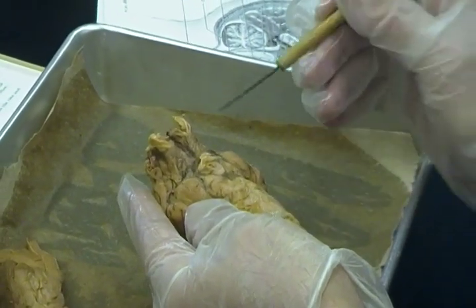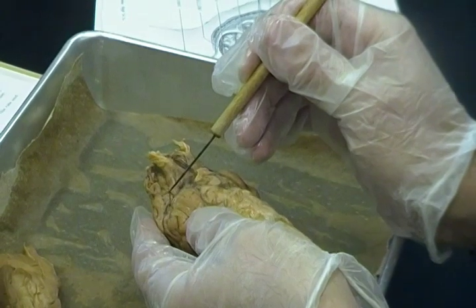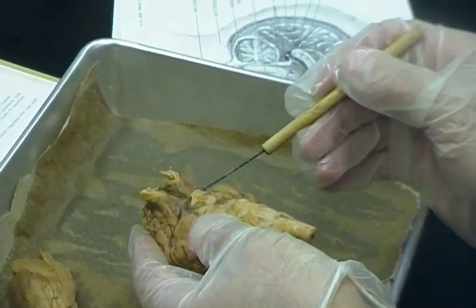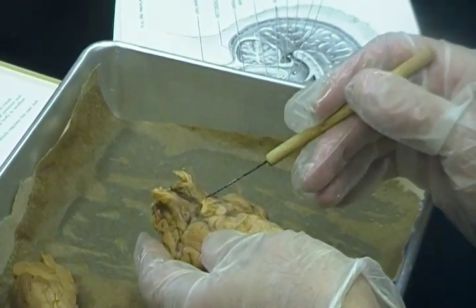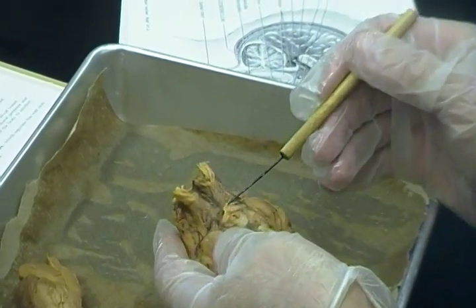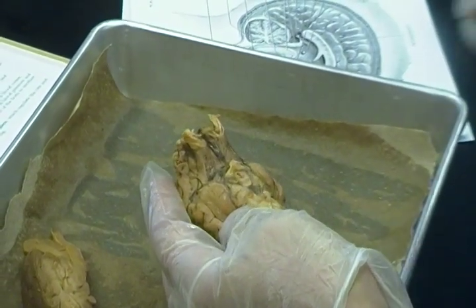Optic nerves. Those are the olfactory? Olfactory nerves. Very good. You guys are quick, okay? This has been cut off here, but this would lead out to this hollow portion, and this would lead out to this hollow portion. Optic? Optic. Very, very good. You're quick. Now, did you have the term optic chiasma on your notes? Okay, that's where the optic nerves cross at that particular point. Your pituitary gland is going to be right back here. So we got olfactory bulbs, and the optic nerves have been cut off, but this section here is called the optic chiasma.